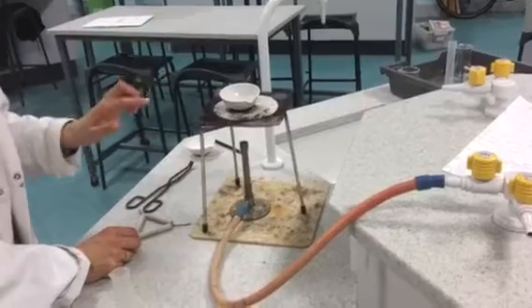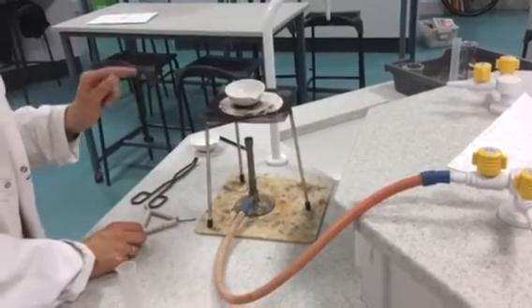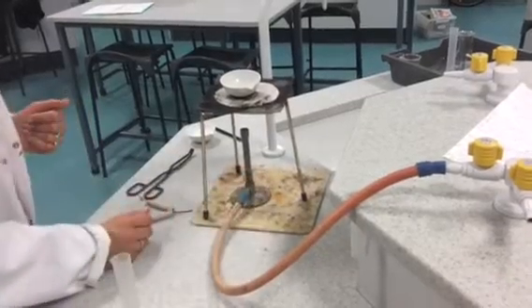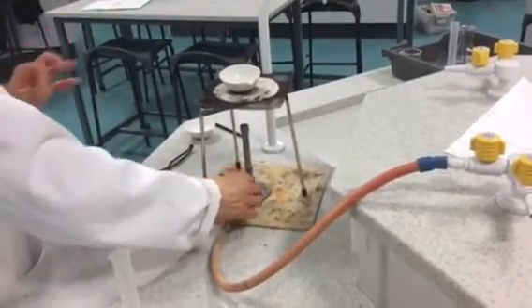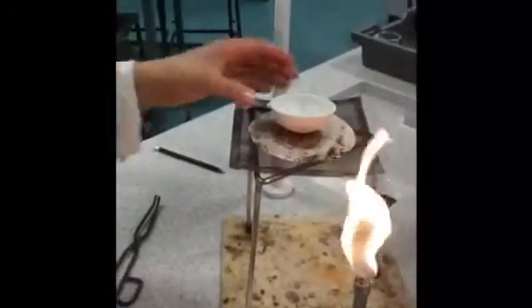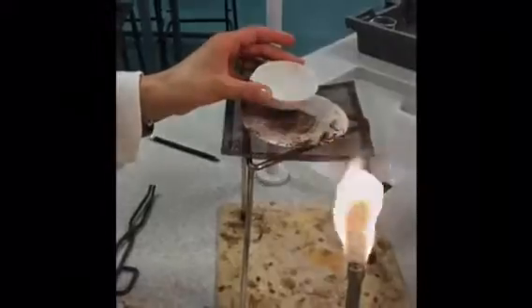Make sure that you don't over-evaporate the water, otherwise the salt will start to spit out and burn you. Evaporate the water leaving some water behind and you'll start to see some salt crystals forming. After about 10 minutes most of the water will evaporate.